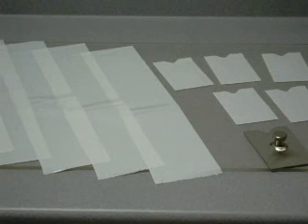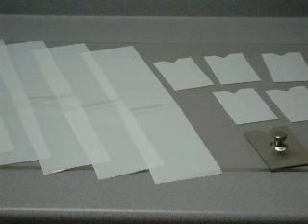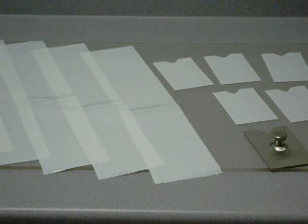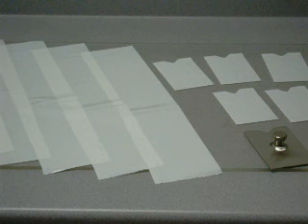Care must be exercised when handling sample specimens. The test surface must be kept free of dust, lint, fingerprints, or any foreign matter that may change the surface characteristics of the specimens. Plastic films and sheeting may exhibit different frictional properties in their respective principal directions due to anisotropic or extrusion effects. Specimens may be tested with their long dimension in either the machine or transverse direction, but it is common practice to test specimens with its long dimension parallel to the machine direction.